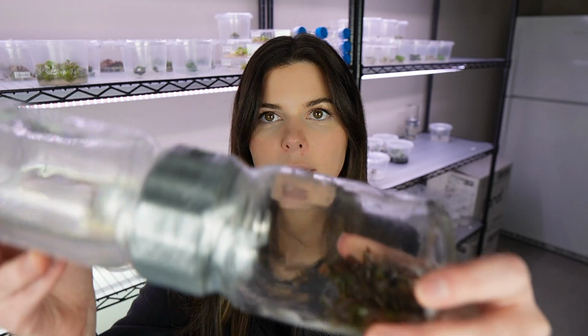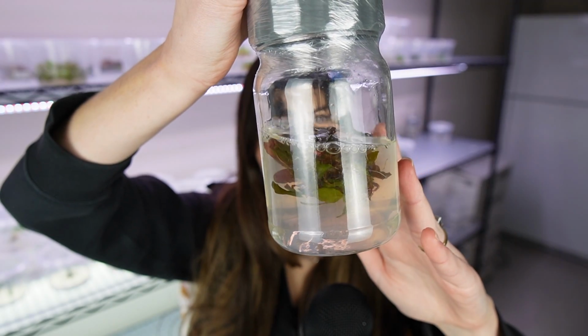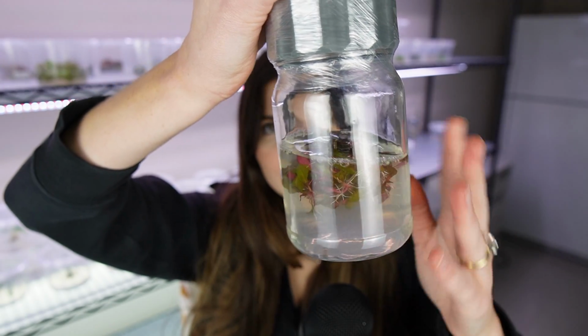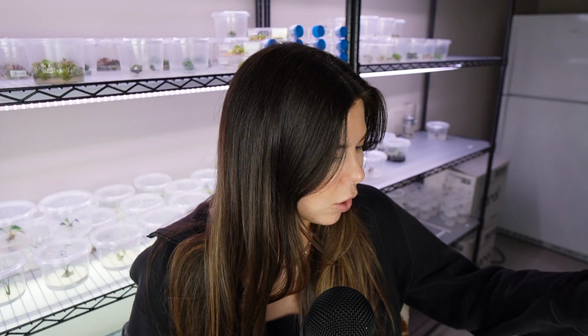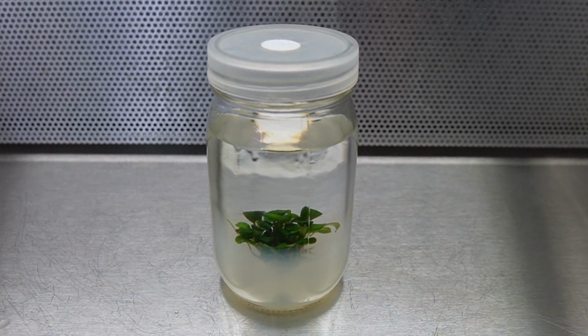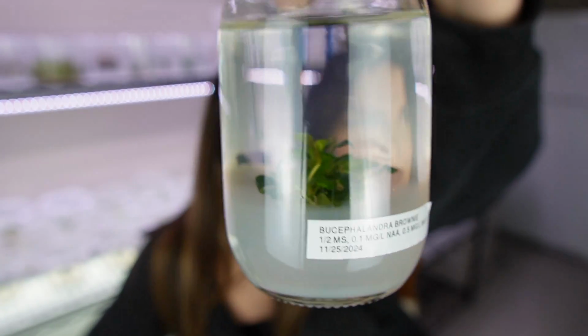The Cardinalis that went into the BioCoupler is likewise contaminated. You can tell by the cloudiness of the liquid tissue culture media. It should really be clear. Not clear: contaminated. The Bacopa, contaminated. On the bright side, this container of Bucephalandra, which as you'll recall had a bug inside of it, is not contaminated, shockingly. It actually looks pretty darn fantastic.